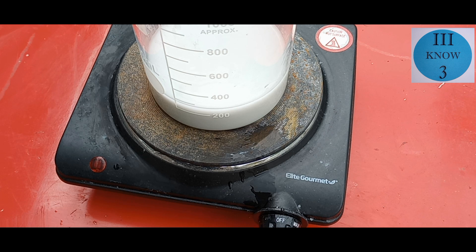The appearance of lead chloride is white or a clear crystal. This crystal formed after I added the hydrogen peroxide in the tin metal acid and electricity video. At first I wasn't sure what it was, but now I think it's lead chloride.